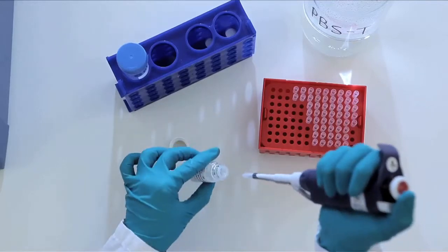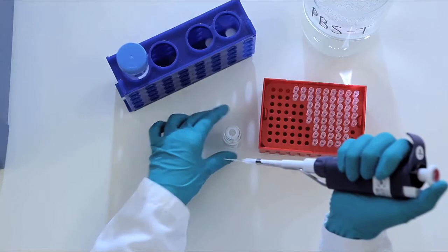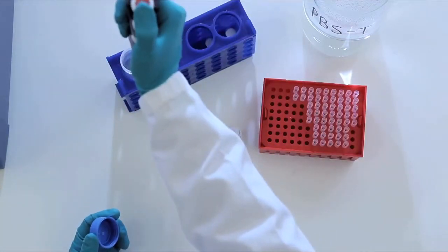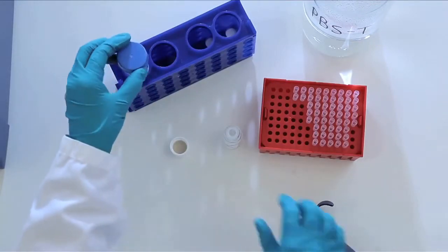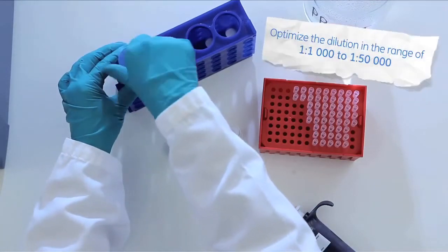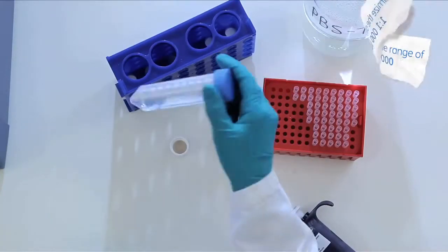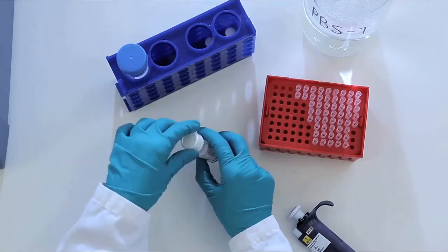Use this time to prepare the primary and secondary antibodies. Dilute your primary antibody with PBST. If working with phosphorylated proteins, you must use TBST. Always use high quality antibodies and optimize the dilution in the range of 1 to 1000 to 1 to 50,000. Using ECL Prime keeps precious primary antibody use to a minimum.